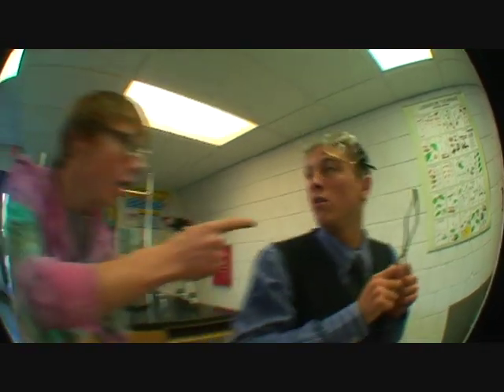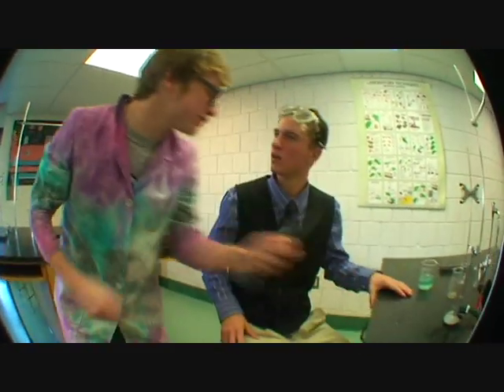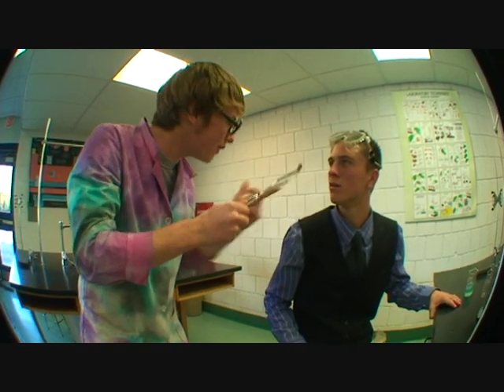Hey there, Jamal! Personal grooming is left for outside of the laboratory. Never use these to pick your nose hairs because you don't know where they've been.